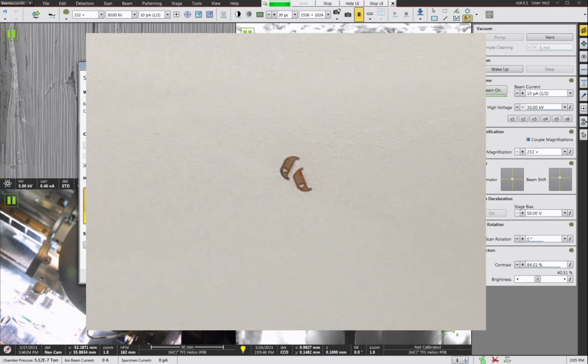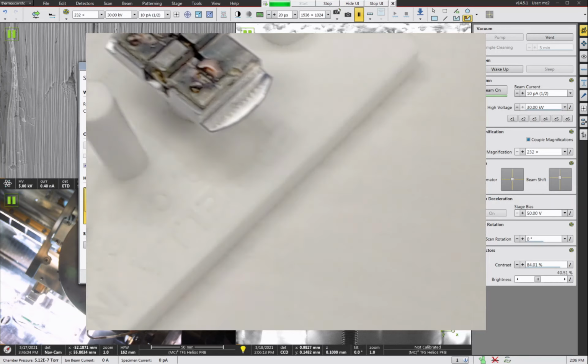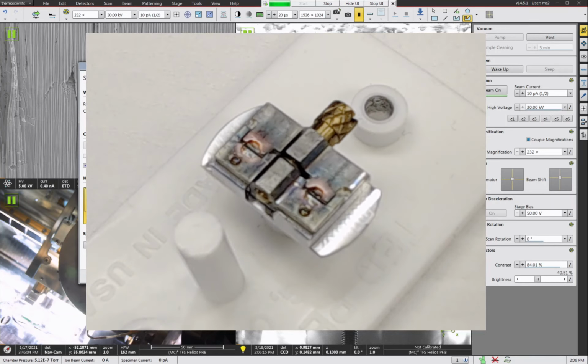or other applications that require the sample to be mounted onto a copper grid or a TEM grid instead of the conventional silicon micropost arrays. To do this procedure, first you need to have some TEM half grids. Now, almost any material will work for this, but the conventional easy to find grids are made of copper. Here I have two grids sitting on a Kim wipe, and we'll go ahead and load these into our suitable TEM grid holder.